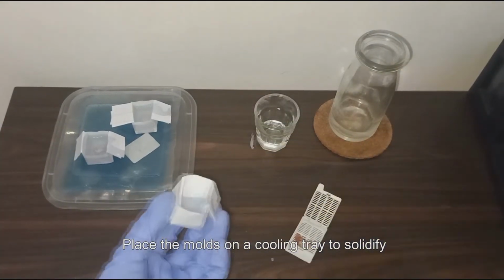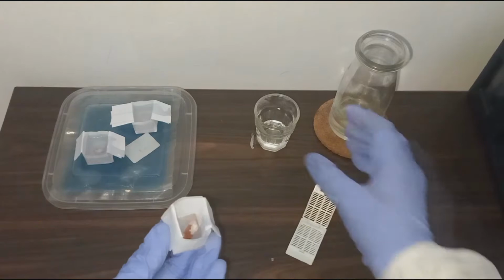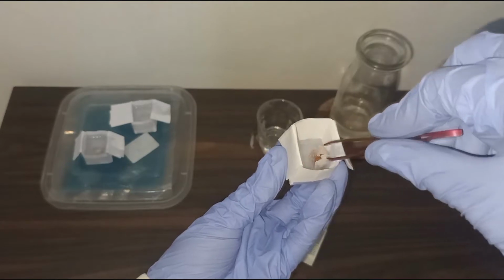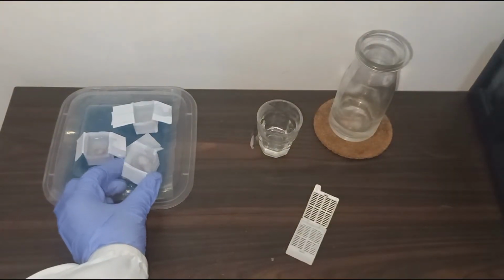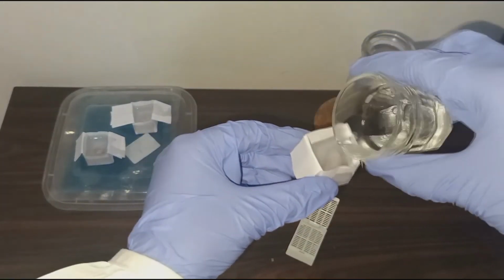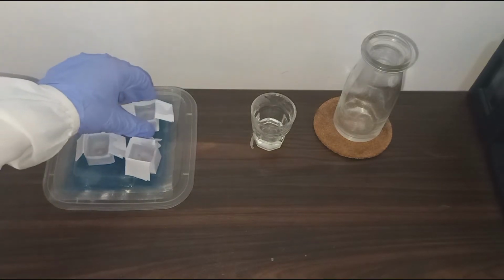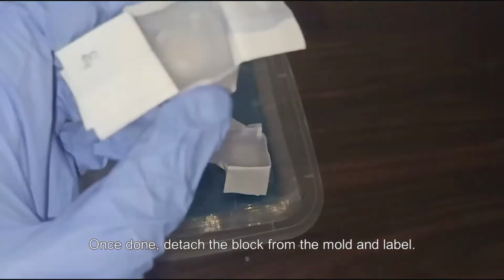Place the molds on a cooling tray to solidify. Once done, detach the block from the mold and then label.